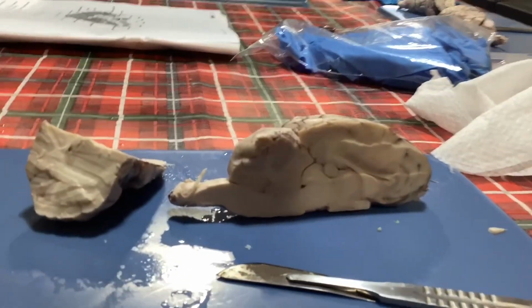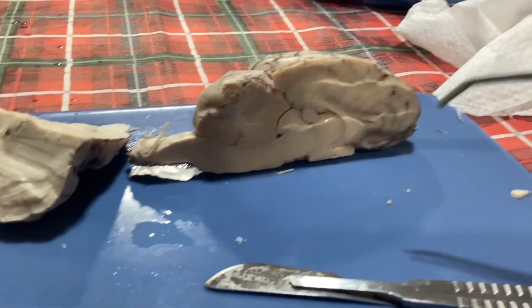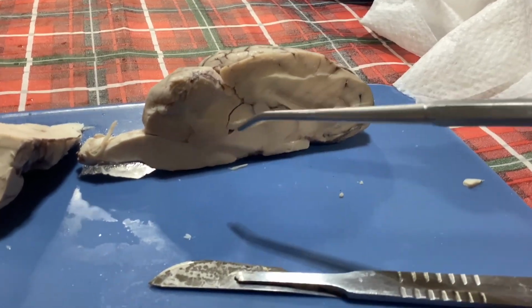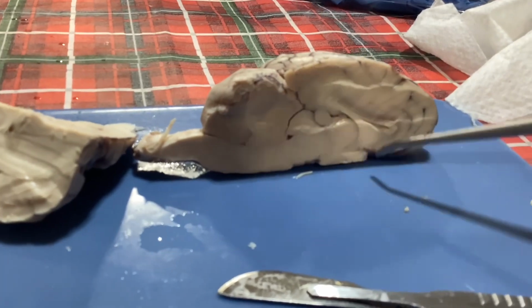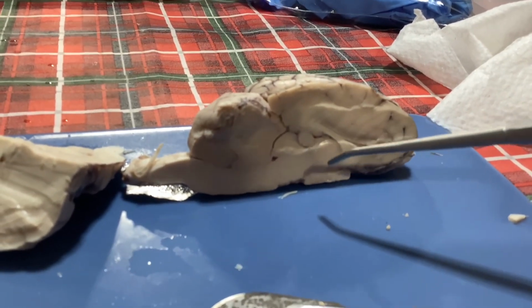And then next we have our gyrus, which is going to be this little guy right here. Next we have our hippocampus, and it's kind of hard to see on camera, but it's going to be this section down here. It's going to be like a little zoop. So we have the hypophysis, or the pituitary gland. It's going to be underneath over here. It's kind of hard to see because it's a little flat, but it's after the midbrain and the pons, and underneath the thalamus and hypothalamus.